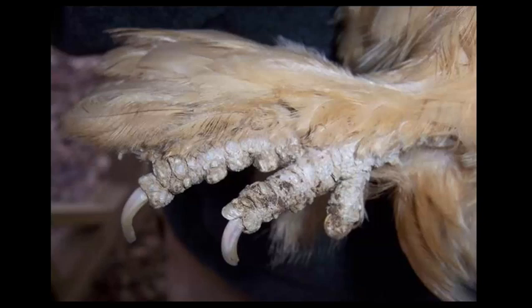When we deal with skin lesions, there's a lot of times you're going to get to use a word that represents crusting or scaling — that word is hyperkeratotic. We've already used it once in this particular challenge. When I'm doing dermatopathology on a gross basis, the terms hyperkeratotic, alopecic, and ulcerative — or maybe necrotizing — are used in the vast majority of lesions.